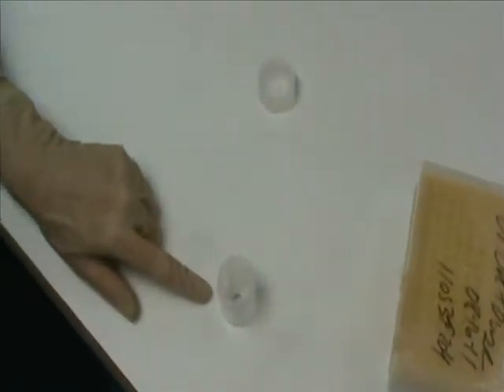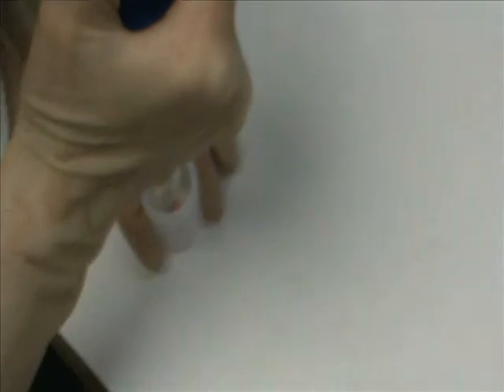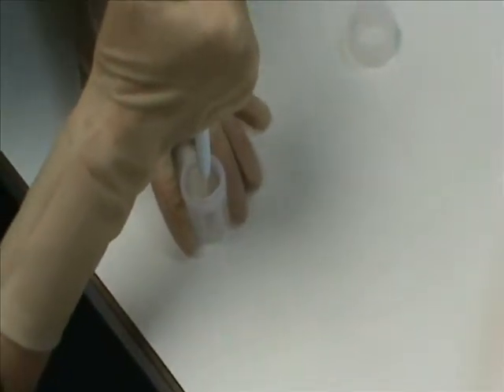Now, the contaminated disk has been placed into the treatment container and an aliquot of test material or test product is applied directly over the inoculum spot and a timer is set.